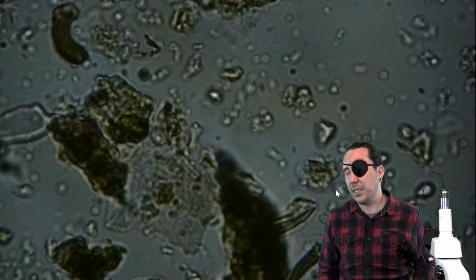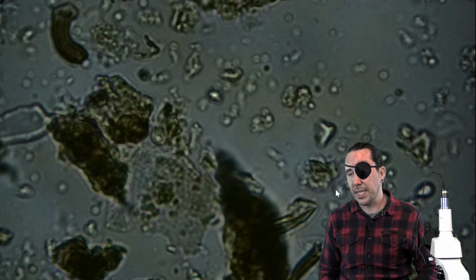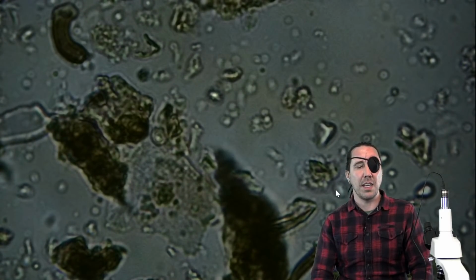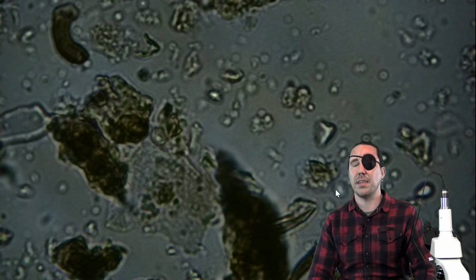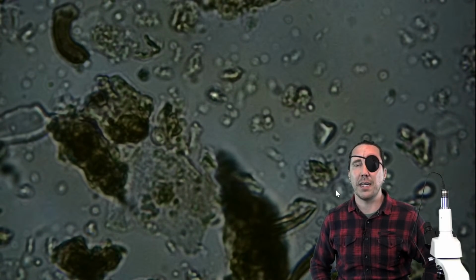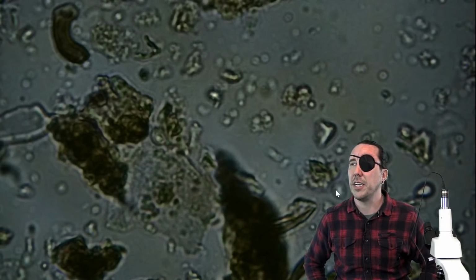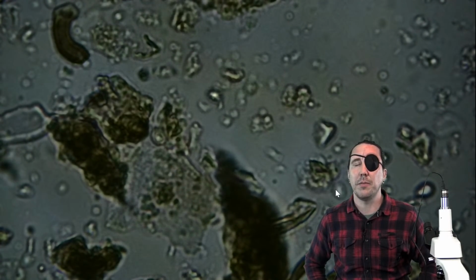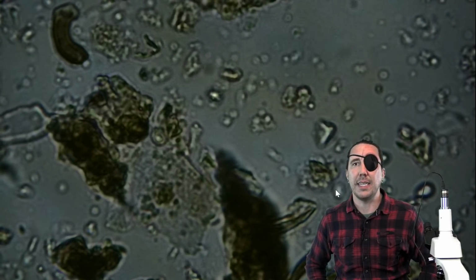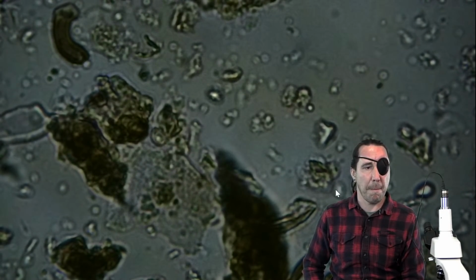The model I'm upgrading to, I don't remember the exact name. It's an Infinity from LW Scientific. Elaine has a new soil food web school, and Keisha Wheeler, who helps Elaine with this new school, worked out a deal with LW Scientific microscopes for soil food web class attendees. It's an I4 Infinity, yep.